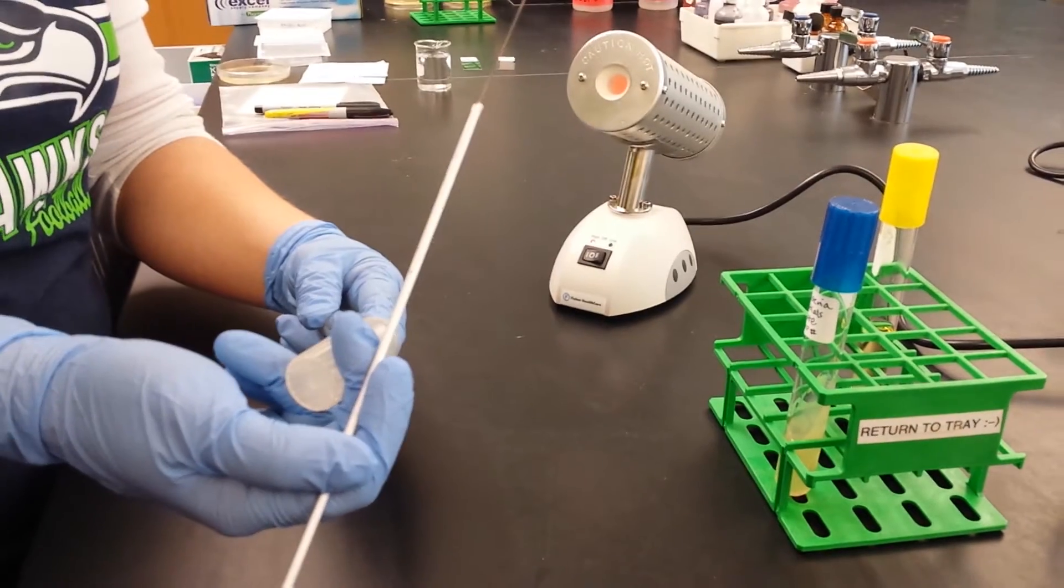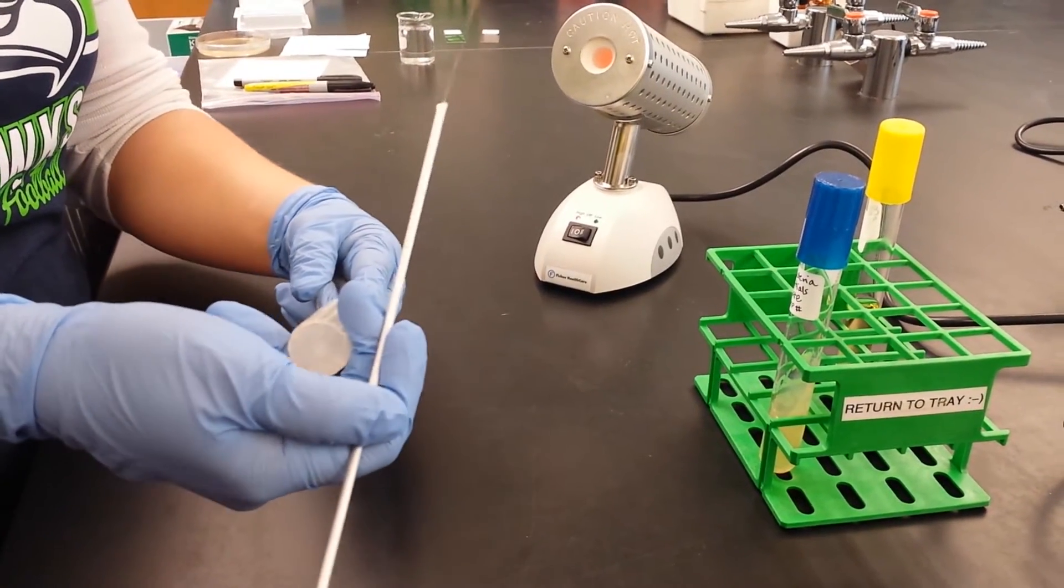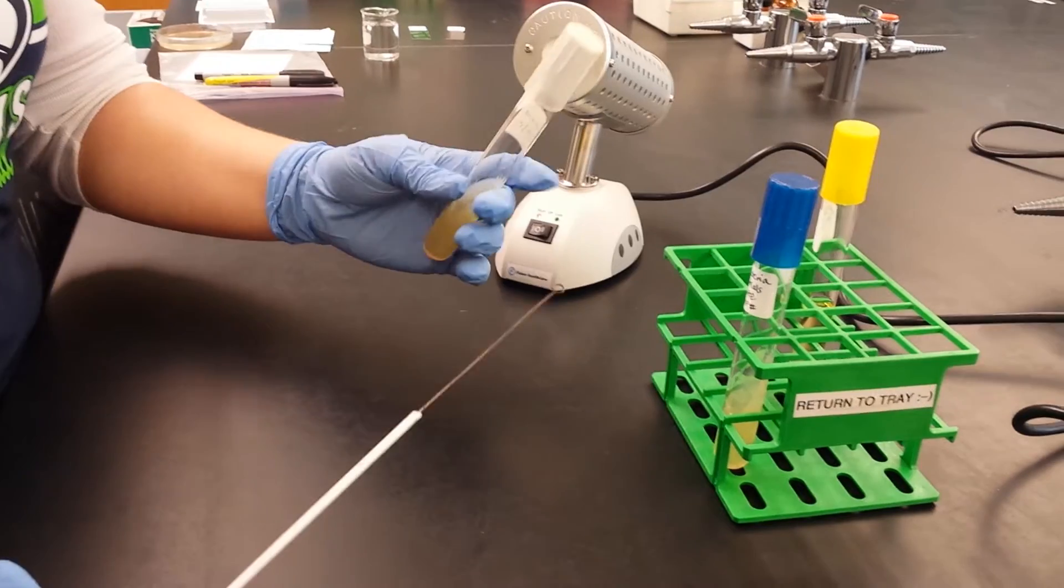Then I'm going to replace the cap, kind of bump into the edge of it like this, and then push down. Make sure the lid's all the way back on.